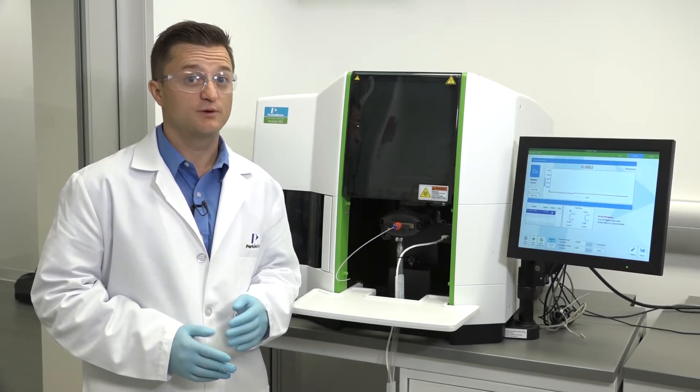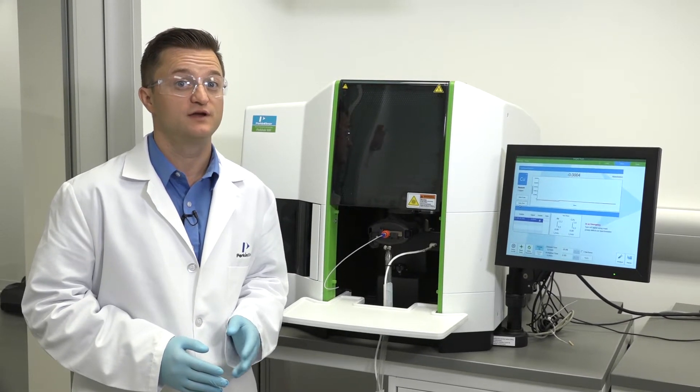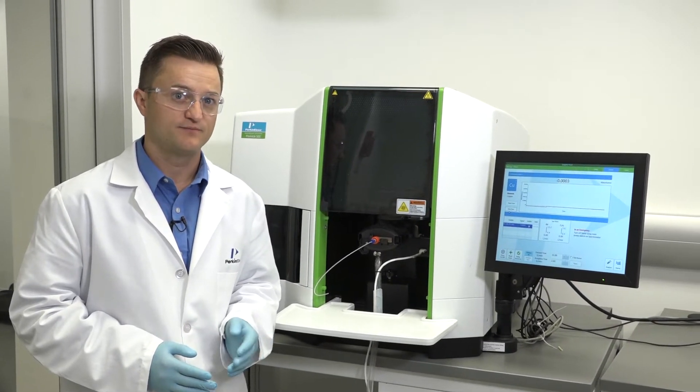For burner head replacement instruction, please watch the Pinnacle how-to video on burner replacement. Note that since the position was optimal prior to removing the burner head, the optimal location is most likely not far off.